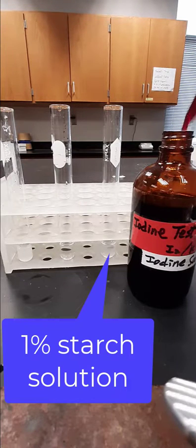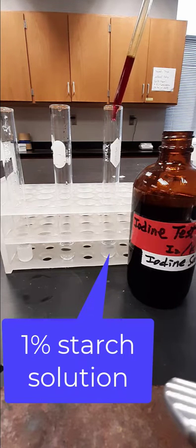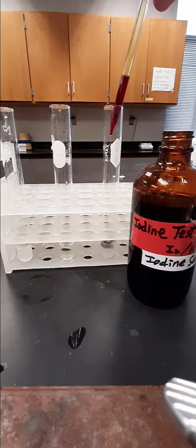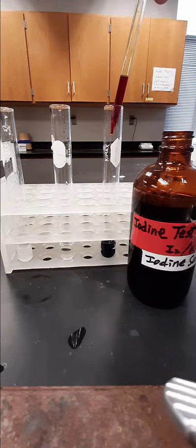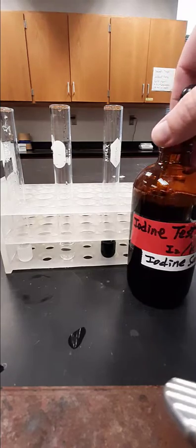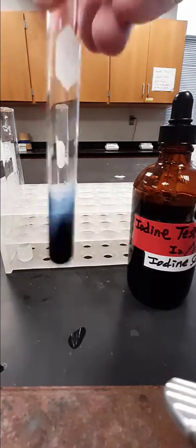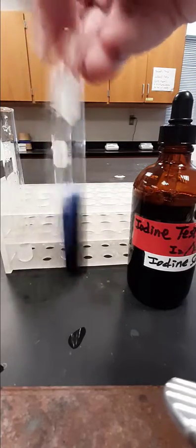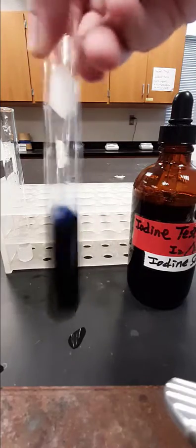Next, I'm going to test the contents of the tube on the right for the presence of starch by adding a few drops of iodine solution. Take note of the color of the iodine solution before and after it makes contact with the starch solution at the bottom of the test tube. You can clearly see that a remarkable color change occurs — the brown iodine solution takes on an intense blue-black color, indicating the presence of starch.